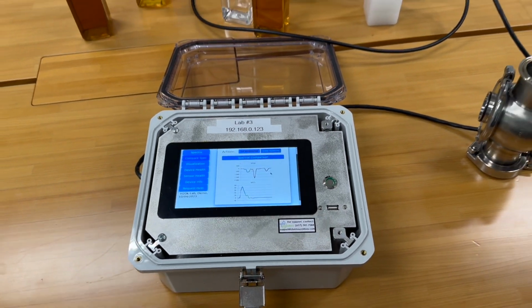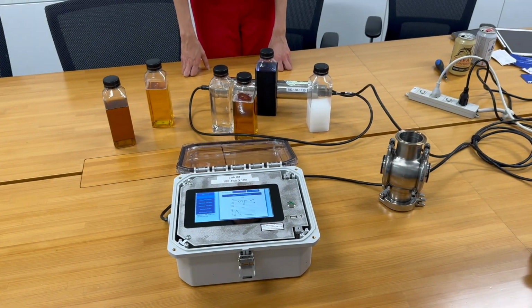This is a live demo of the H2OK innovation system.